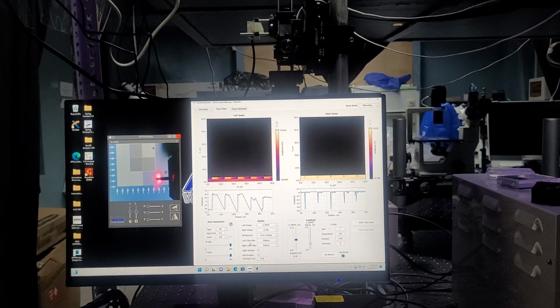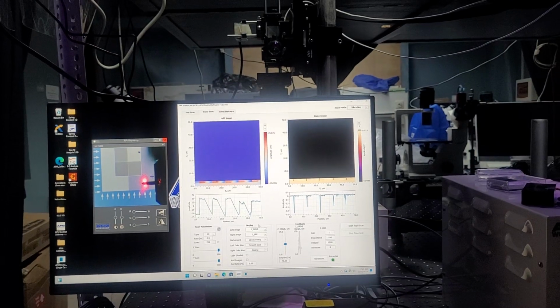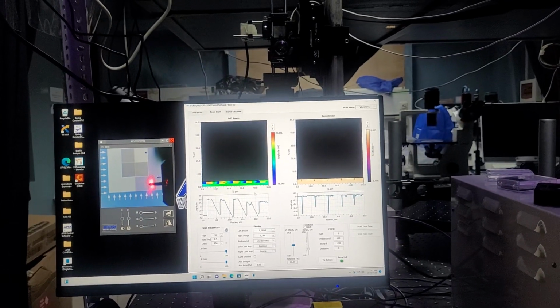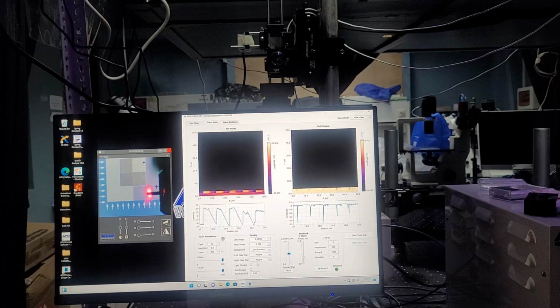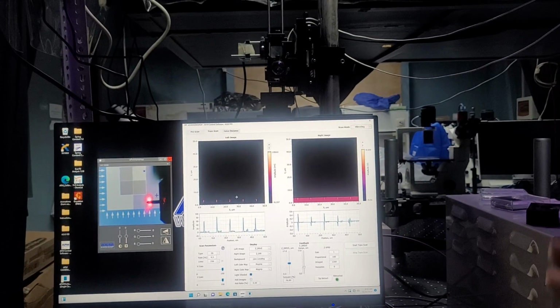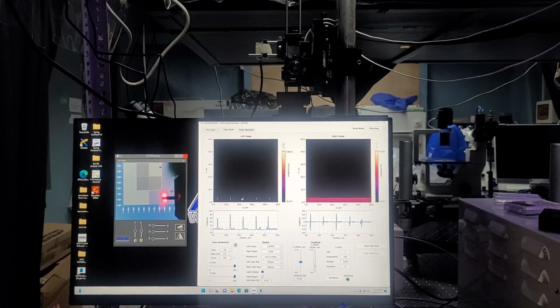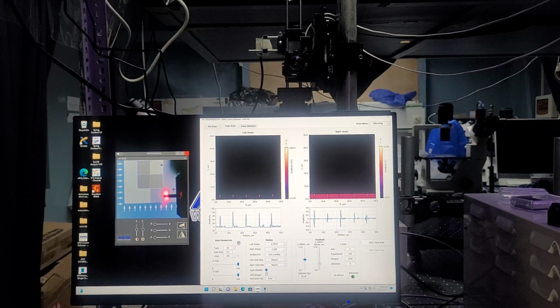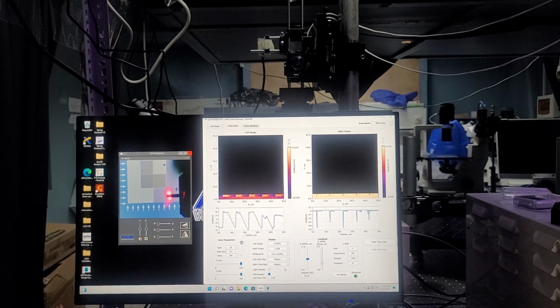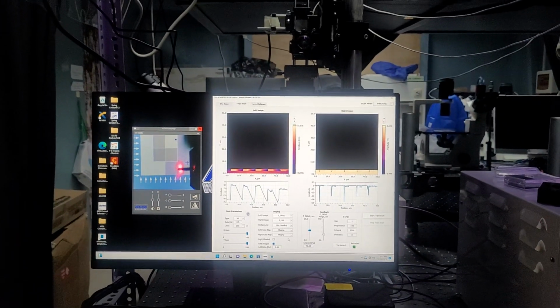Then you have my personal favorite. You have your optional colors. So you can go for magma, smooth, cool, warm. Again, it doesn't change the actual data that's saved, but it can provide a little bit more of an impactful look. You also have light shading, which is another visual technique. It's almost as if it's some kind of derivative technique that provides a much better contrast of the actual sample surface. And then you have the option to add images. So for example, if you have an area that has high error, in this case you could add some of that error into your topography. Again, it's just visual. It doesn't change the actual values that are saved.